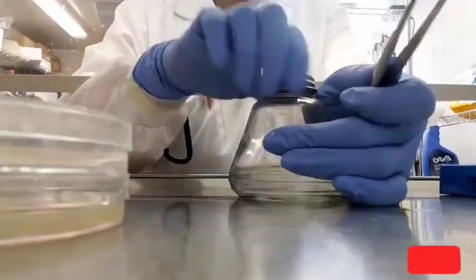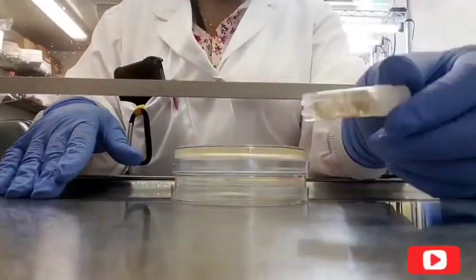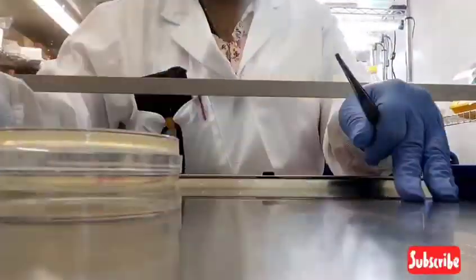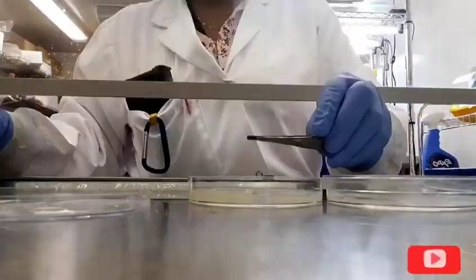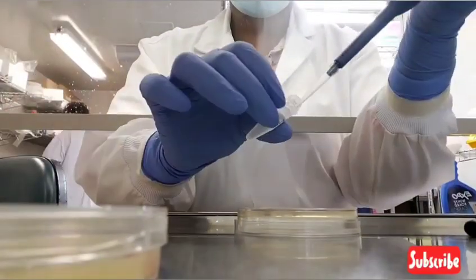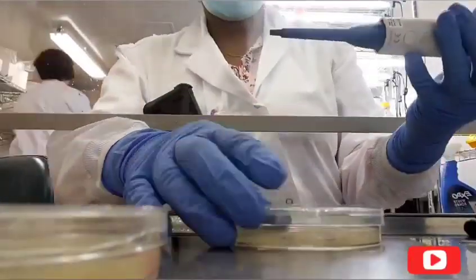You'll notice that I heat sterilized in between a few of the plates. So I'm actually subculturing 3 different isolates of the fungus. And so each time I'm going to change isolate, that's when I will sterilize. So I'm just dipping it into the ethanol, putting it into the flame, let it cool.